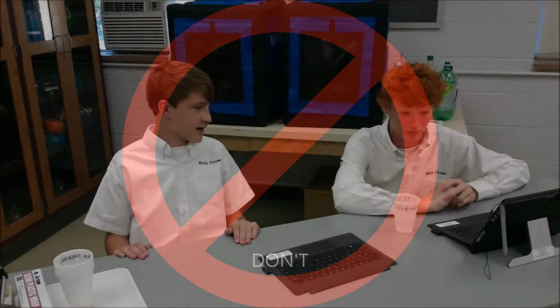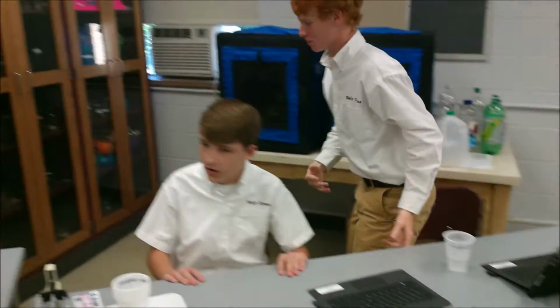Do you know where any deadly uranium is? I think it's in the storage room. I'll go get it. Oh, okay. Thanks. You're welcome. Oh, where's it at? Oh, there it is.